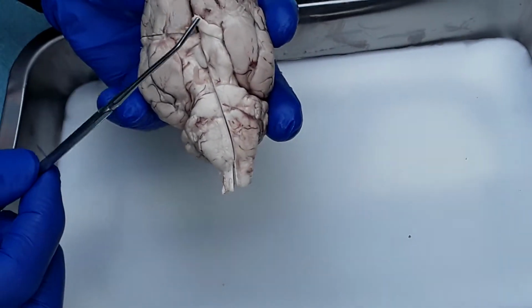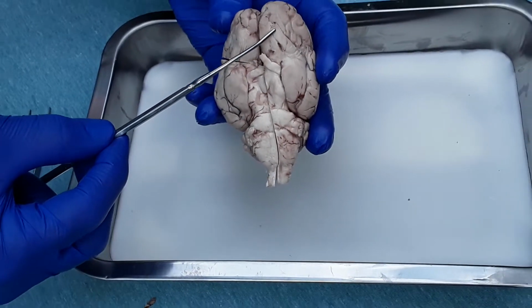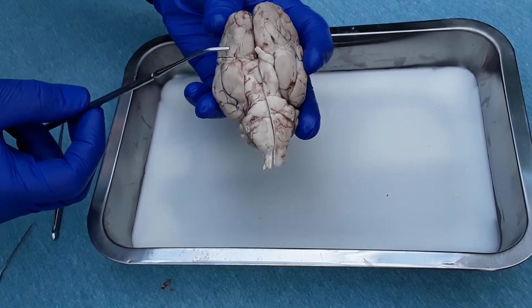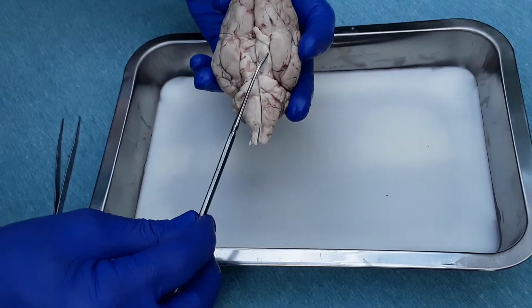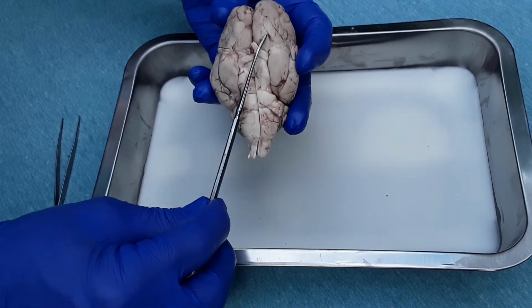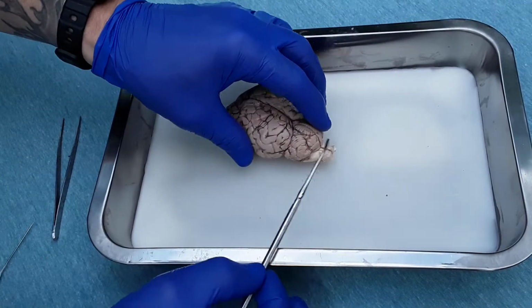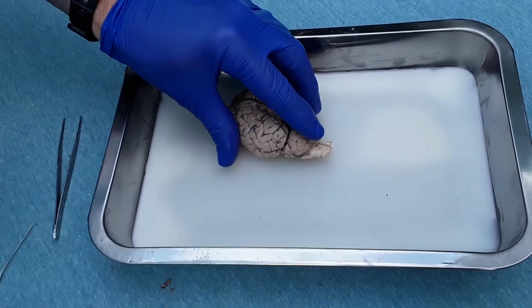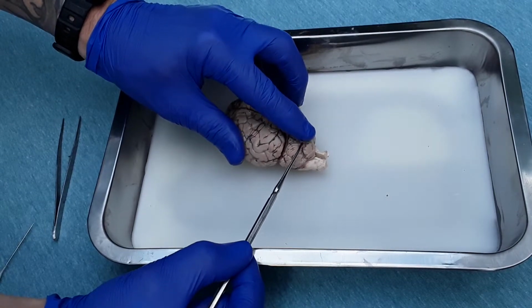This particular specimen didn't come with a very good olfactory bulb. It would be two parts that jut out right here and right here. Also the optic chiasm, where the optic nerves cross. As you can see, here are two of the nerves. The spinal cord is here to the posterior, right under the cerebellum, the small part right here. This is the cerebellum, or what they call the small brain.